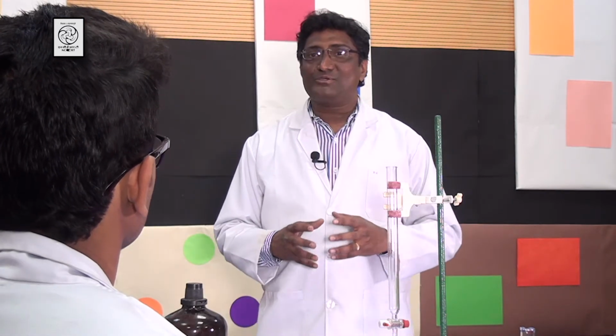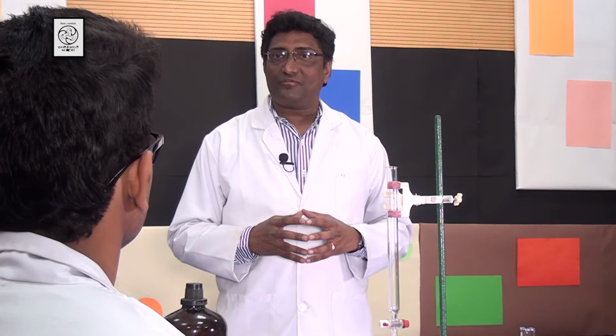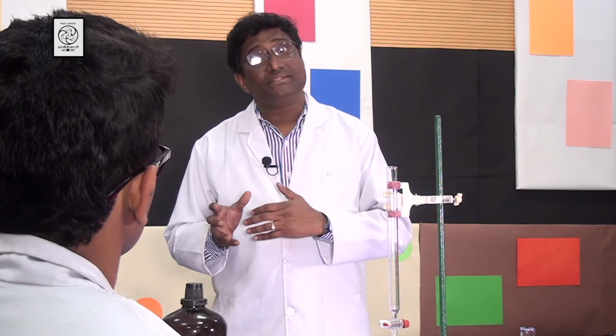Hello students. Hello, sir. Students, today I am going to show you how to purify a mixture of compounds using column chromatography. Column chromatography is a powerful separation technique which has wide applications in various branches of chemistry, biology and pharmaceutics, which have wide applications again in industry.